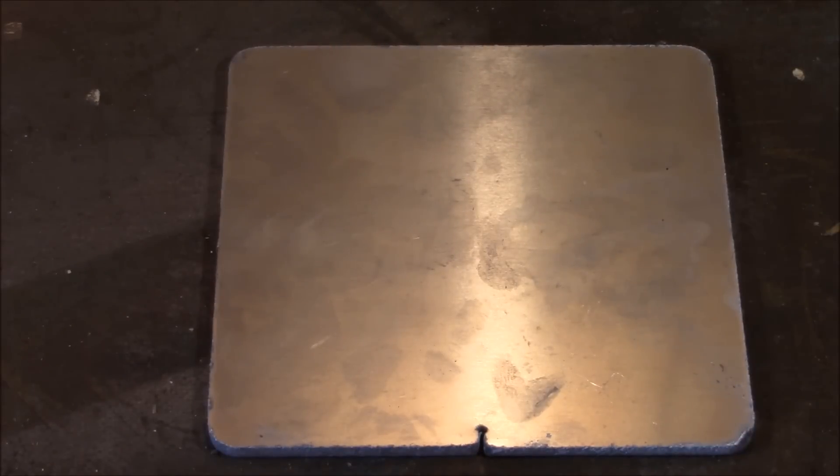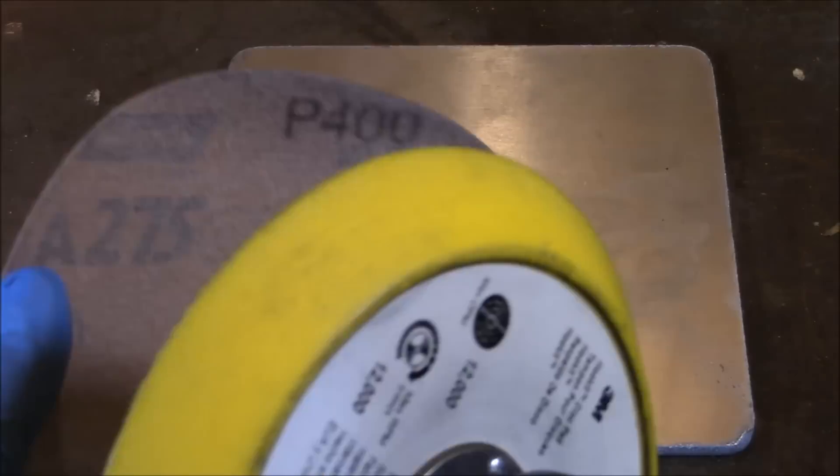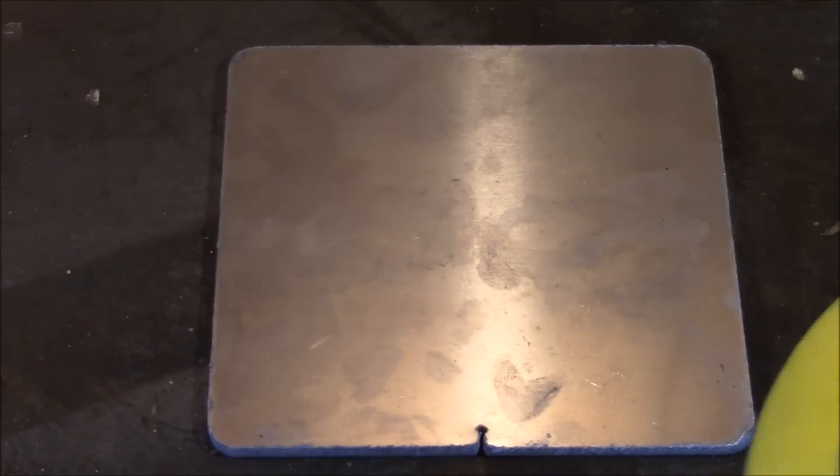Hello and welcome to Skills in Trade. In today's exciting video we're going to learn what happens when we add mercury to aluminum.